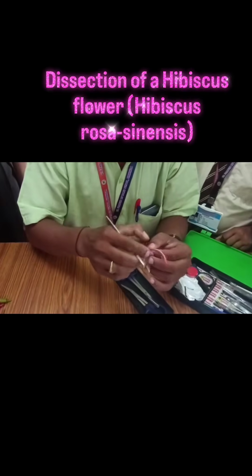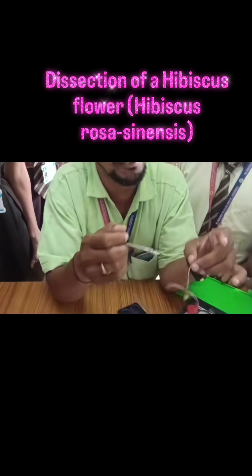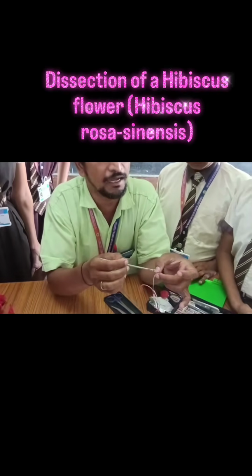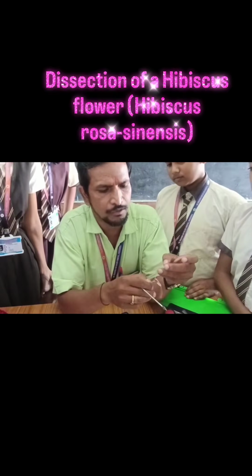This is a tube. Yes. So from this tube, the pollen grains are deposited here on the stigma. Yes, and then it goes from this tube to the ovule.